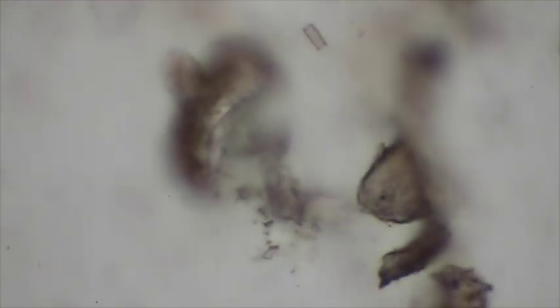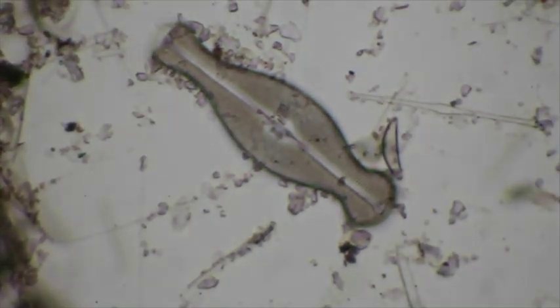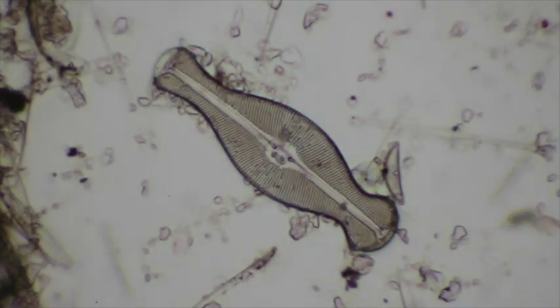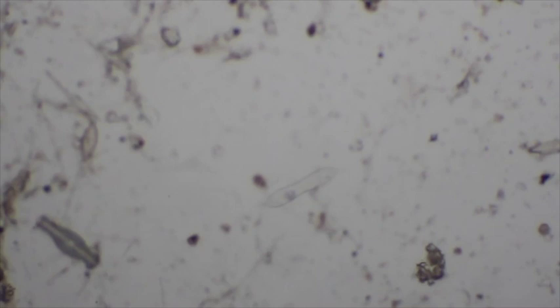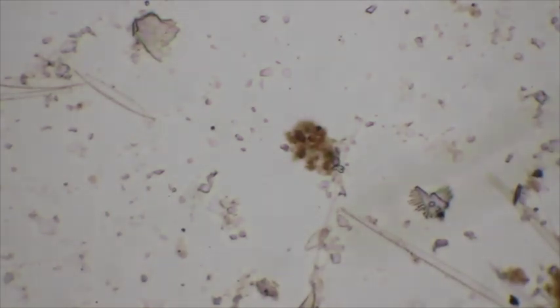Increase magnification to the 40x. And focus. Some cool ones there. You see the nice little siliceous shells on the outside. Here's a very nice one that you can identify. There, that's a nice image of that guy. Shoot back to the 10x magnification. And I will look for more guys. One dead center there. Put it up to the 40x magnification.